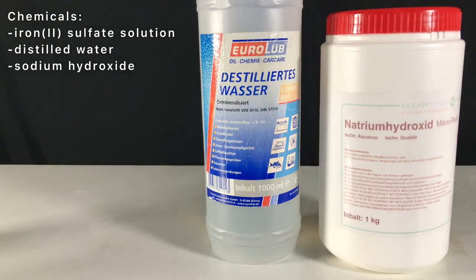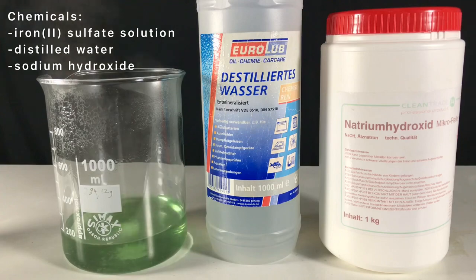For this, sodium hydroxide, distilled water, and the iron 2 sulfate solution are needed.